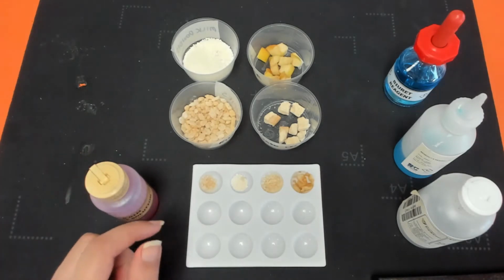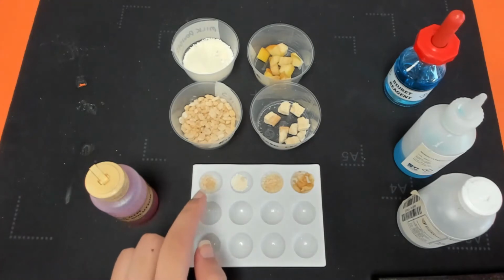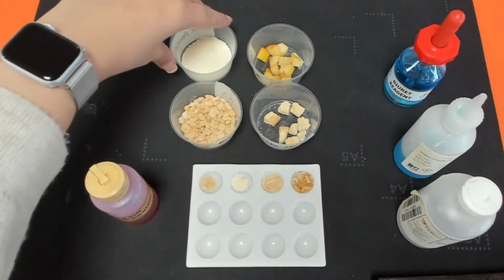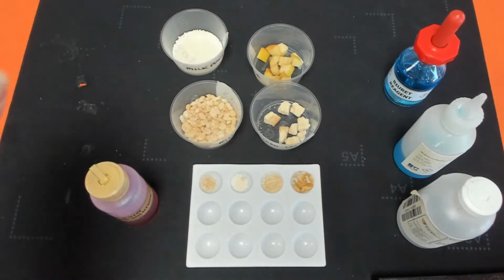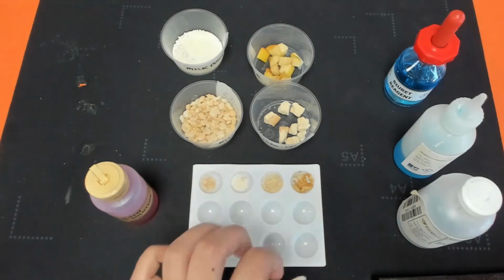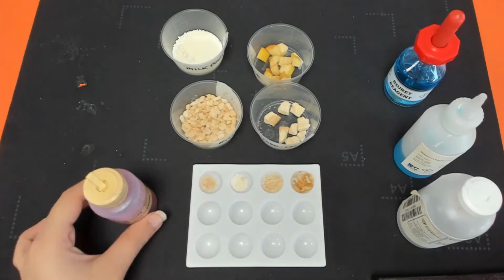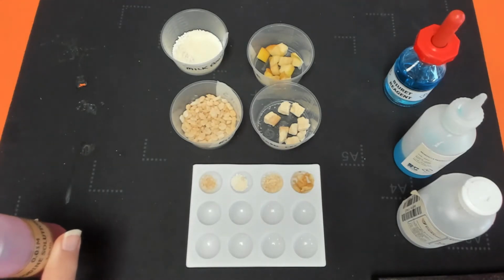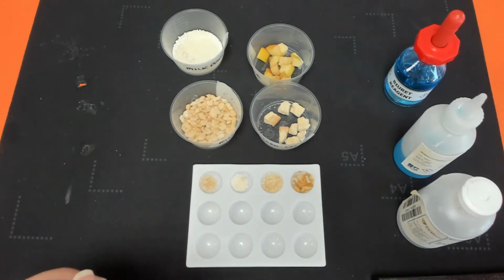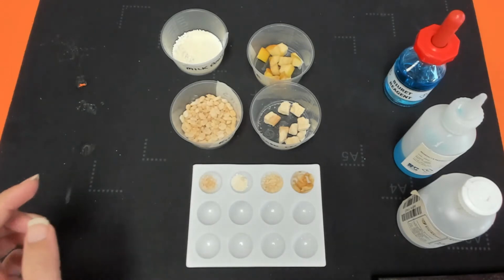So within this tile, I've mushed up different bits of food. So in the first one, I've got some Rice Krispies. Then I have got some rice powder, milk powder even. Then I've got some custard creams mushed up over here, and then I've got some slightly rotten apples. So what's going to happen is we're going to add some of this iodine solution to each well, and we're going to observe what we see, so what kind of reaction happens. So I only need a couple of drops, so I'll start with my Rice Krispies.